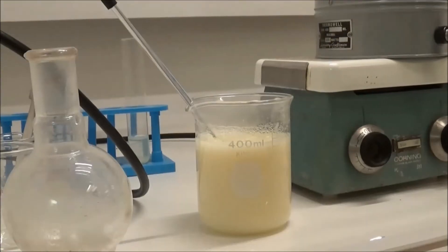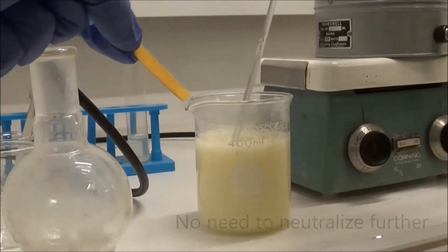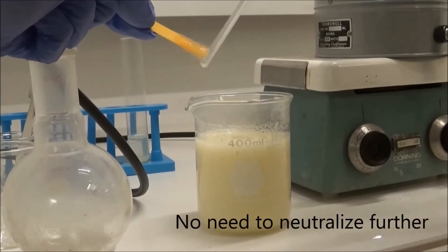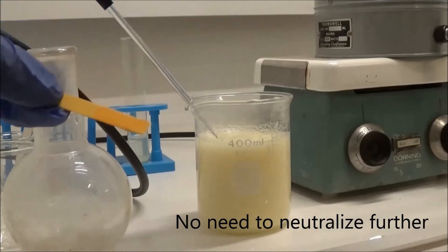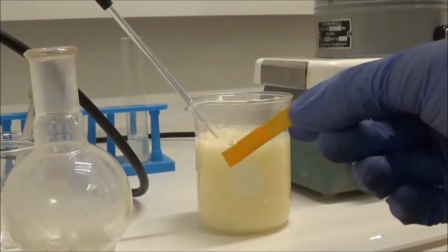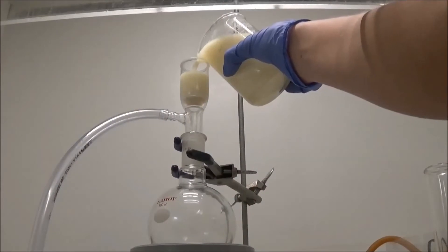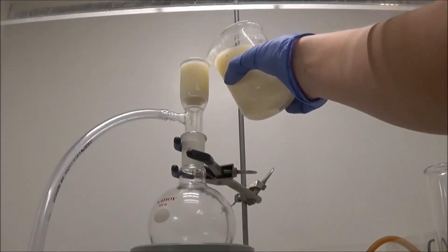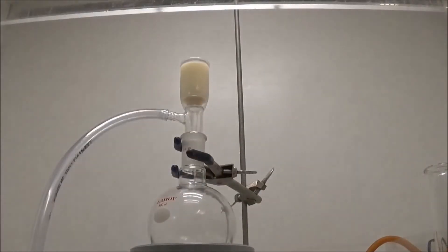I tested the mixture's pH and found it to be only slightly acidic. I moved on to filtering because of this. The crude product was filtered off under vacuum, washed with a small amount of water, and transferred to a 150 milliliter beaker.